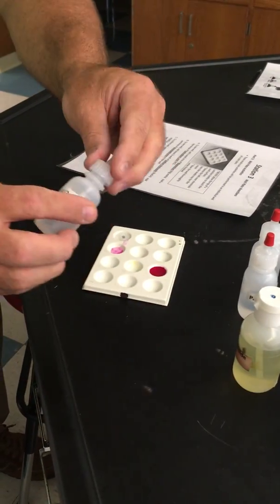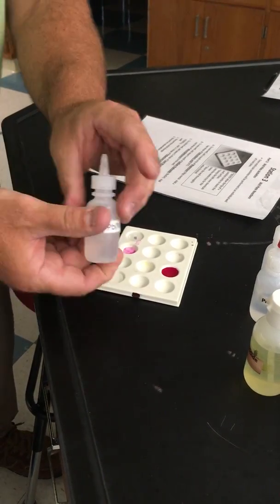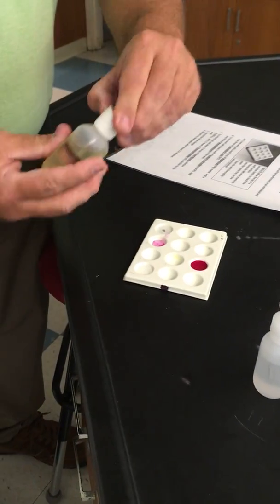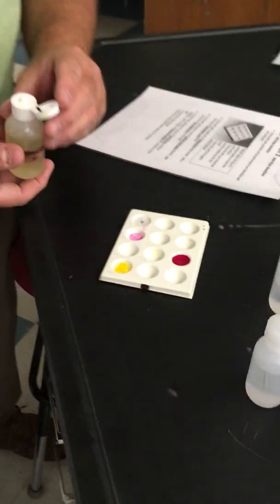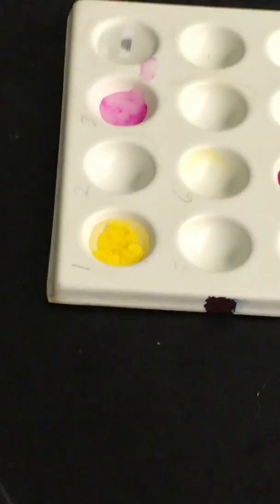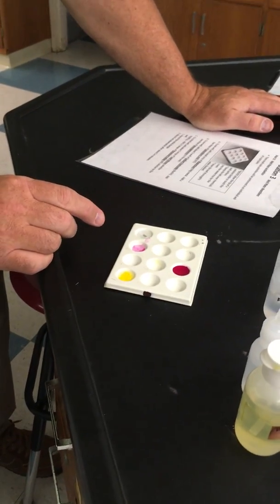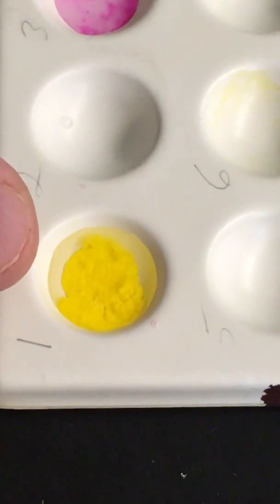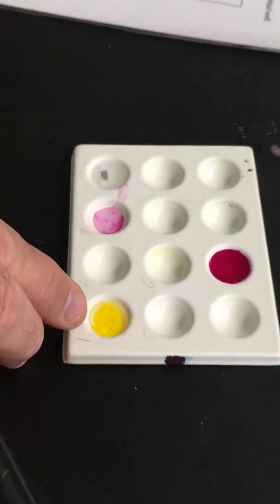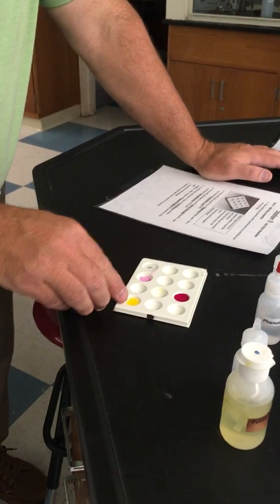All right, the third well, we're supposed to put lead nitrate, this PbNO3. Again, this is a clear liquid. And we're going to put this other relatively clear liquid called potassium iodide in it. And immediately it turns this really pretty canary yellow. So from this one, you should see color changes are a sign that something chemical happened. Plus, if you get really close here, you can see that there's some solid in there. That's the 4th sign of a chemical change, is the formation of a precipitate. This is 2 liquids mixed together that form a solid that sinks out. That's a sign of chemical change right there.